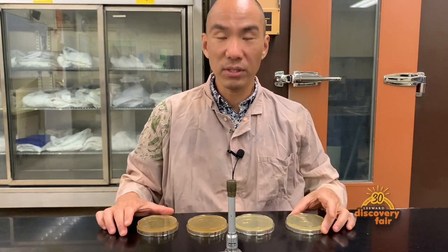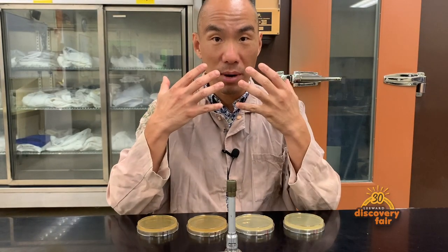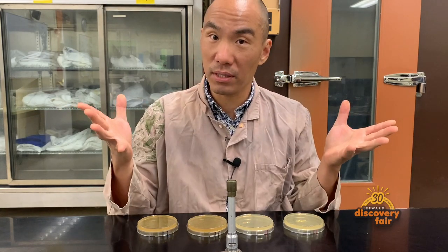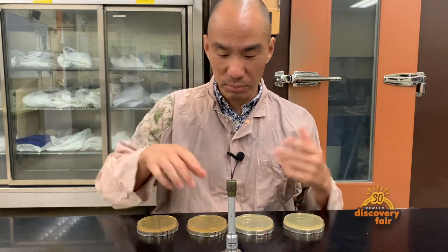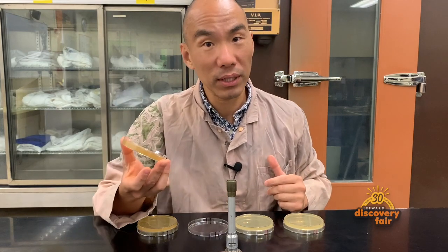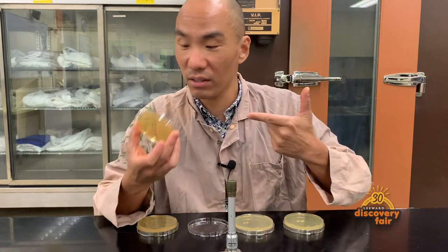Our experiment today is going to be to take bacteria from our mouth and put it onto the plate and see what happens. To do that, we're going to do it very simply — I'm simply going to open up the plate and stick my tongue on it.